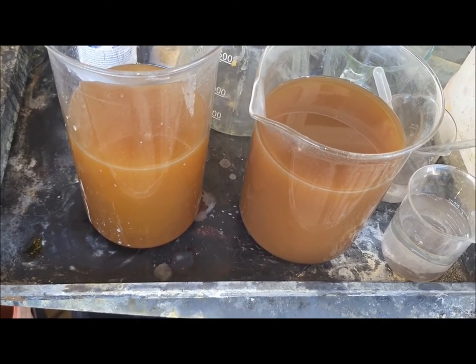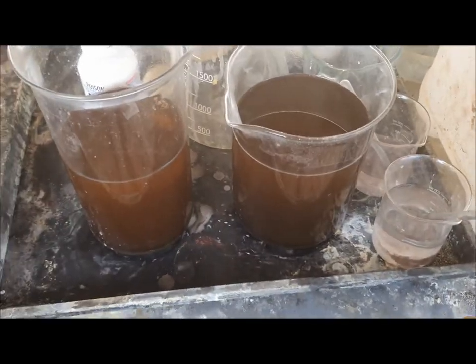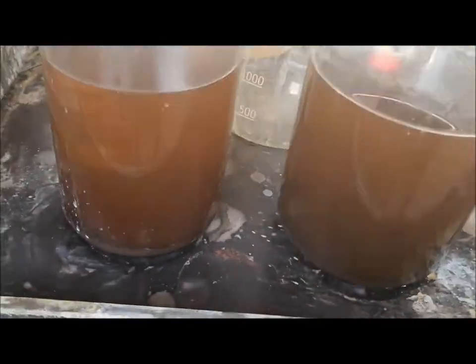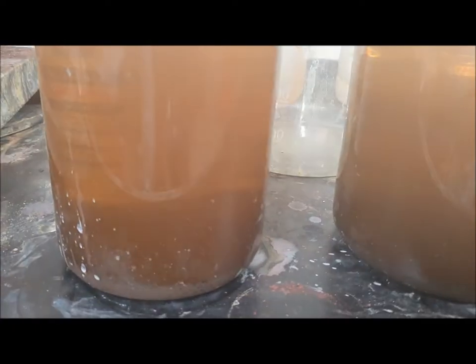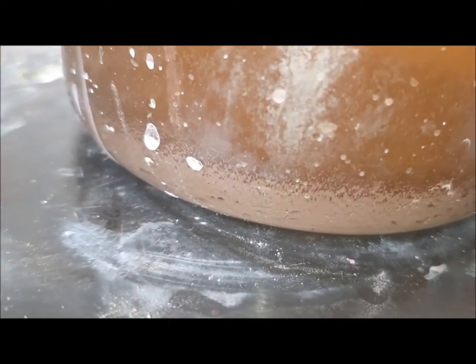There's the white foam, a little bit more just to make sure there's plenty. See it's starting to change colour already — there it goes. Really nice. I'll let them sit for however long it takes — it could be just an hour or two, it might be overnight. Should be lots of gold powder at the bottom.